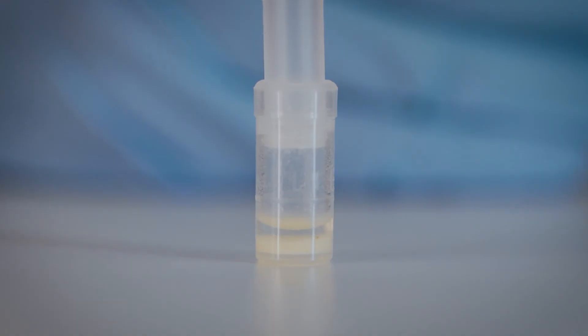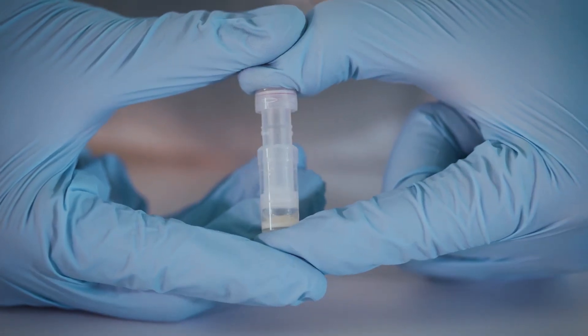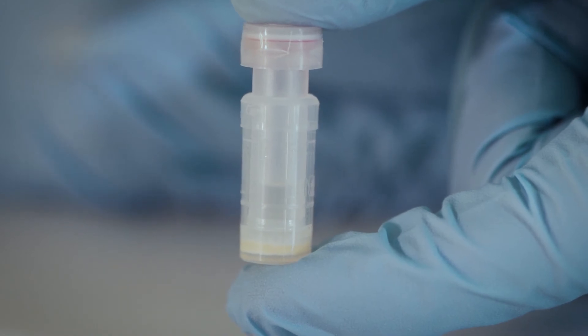Oh yeah. And then you can see now the protein is precipitated. And now all we have to do is just push down. And this is ready to go in the autosampler.